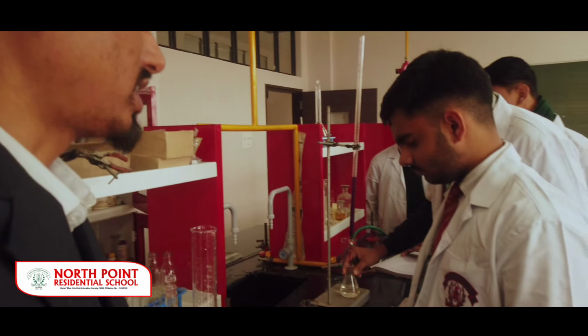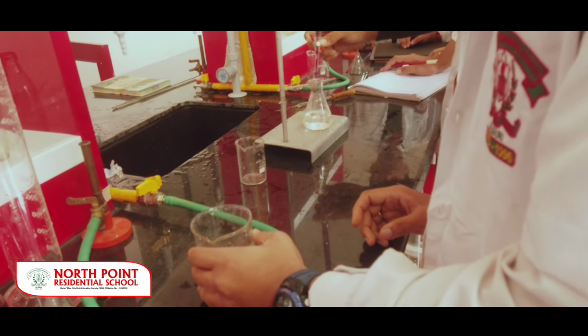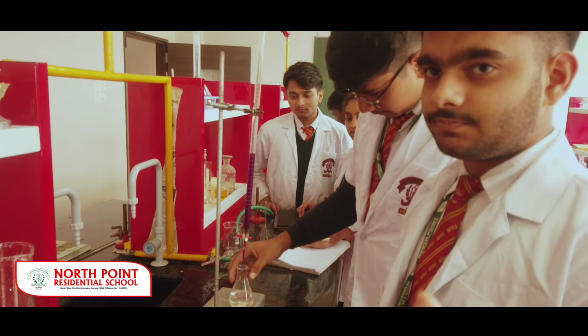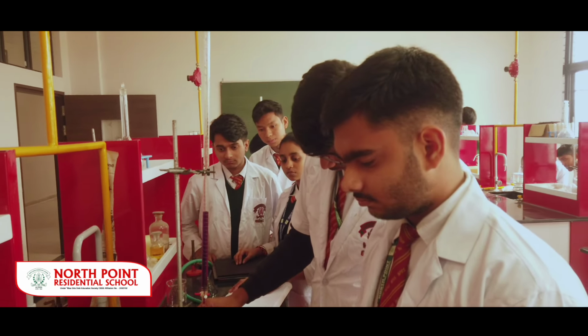Thank you so much. So now we are in the second desk, and the boys are students of class 12 science who are conducting this chemical experiment. So we would have a word with them and try to know what experiment they are conducting, and as compared to the experiment that we just covered, it looks quite different. So let's know what is the basic difference.